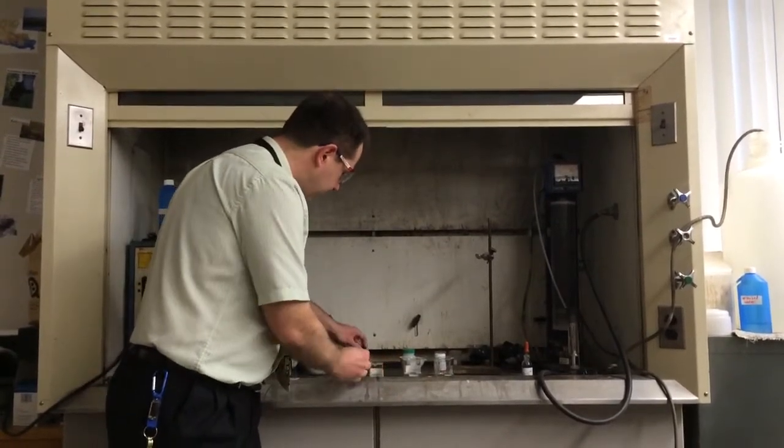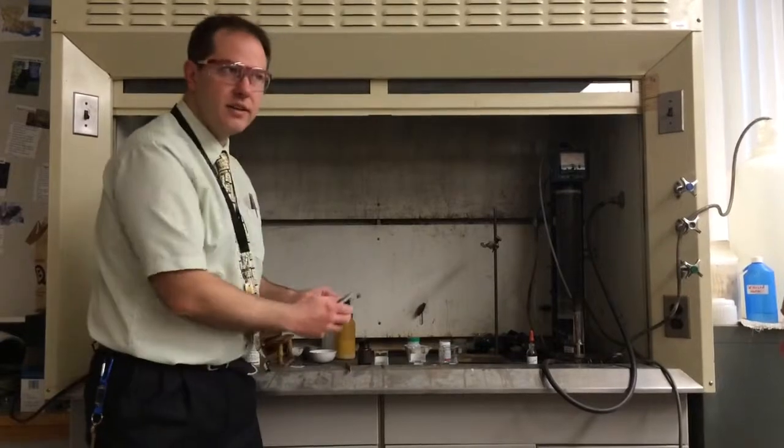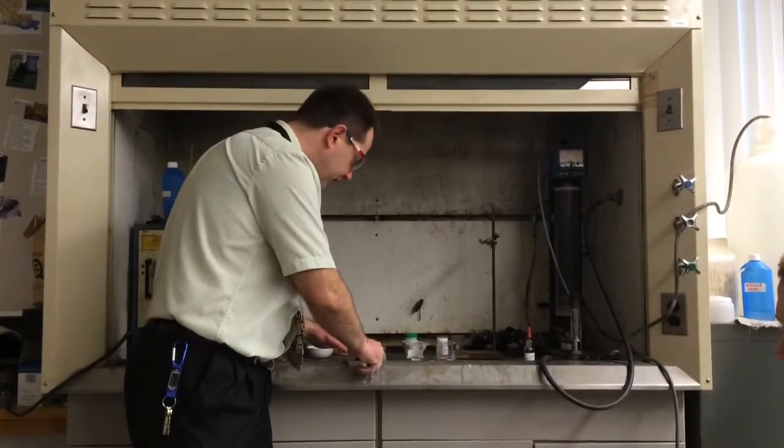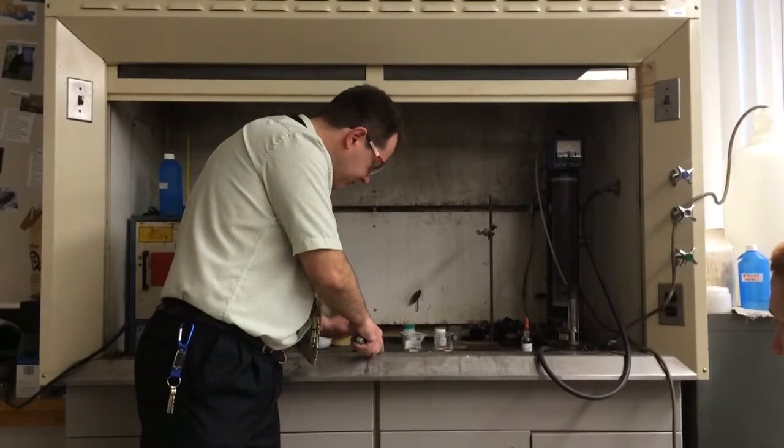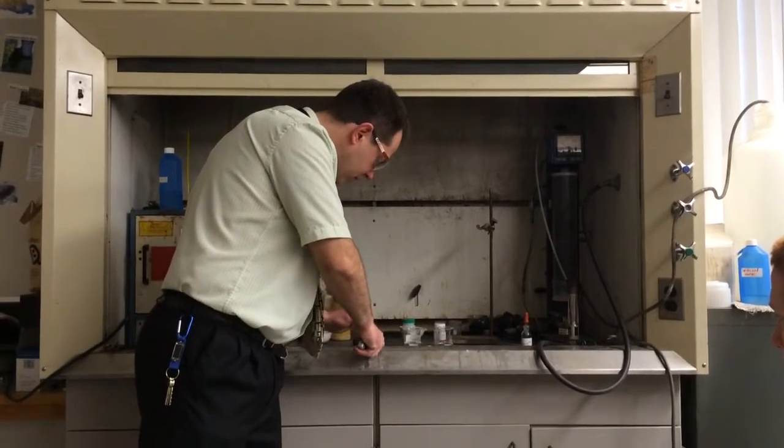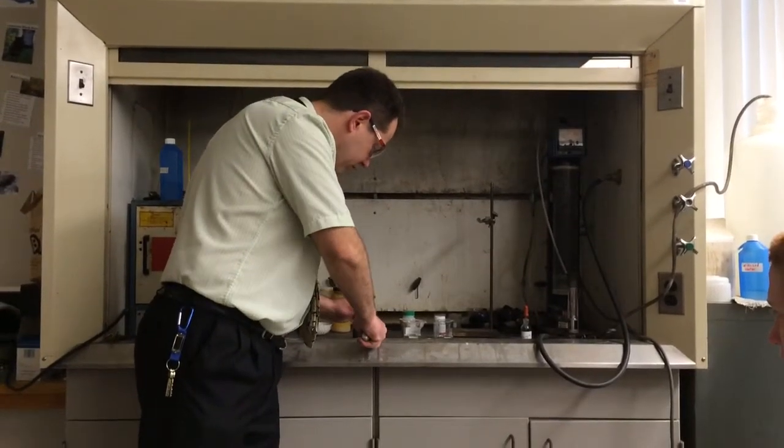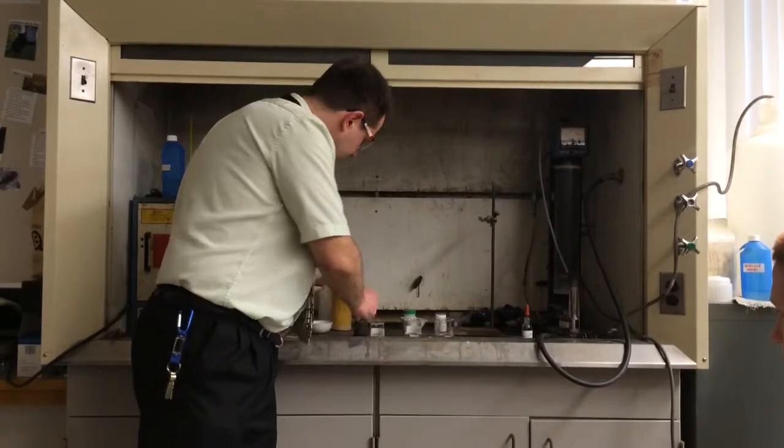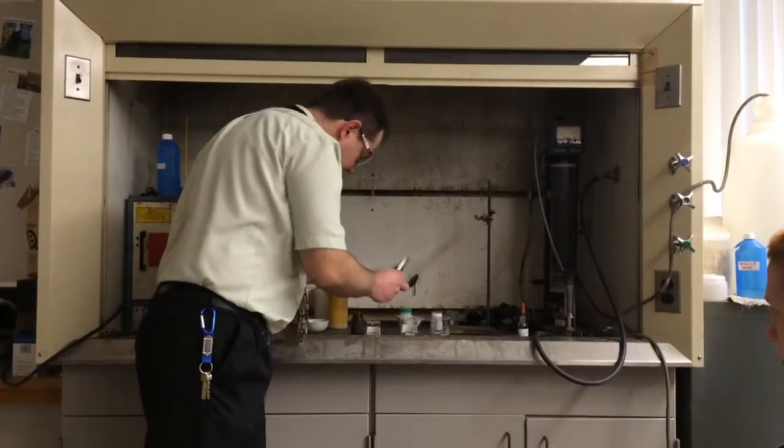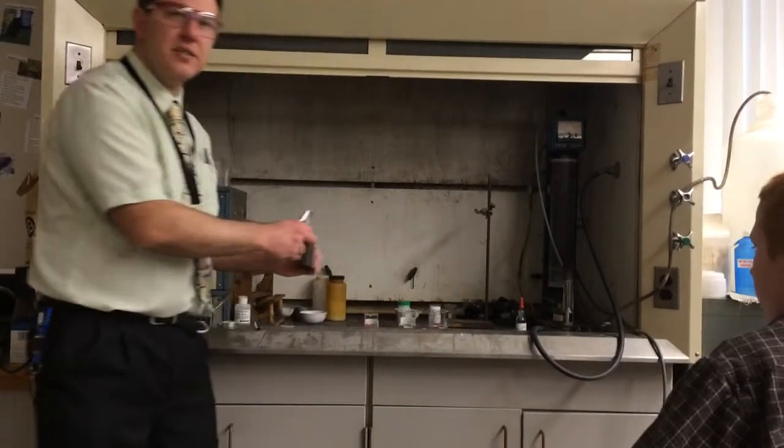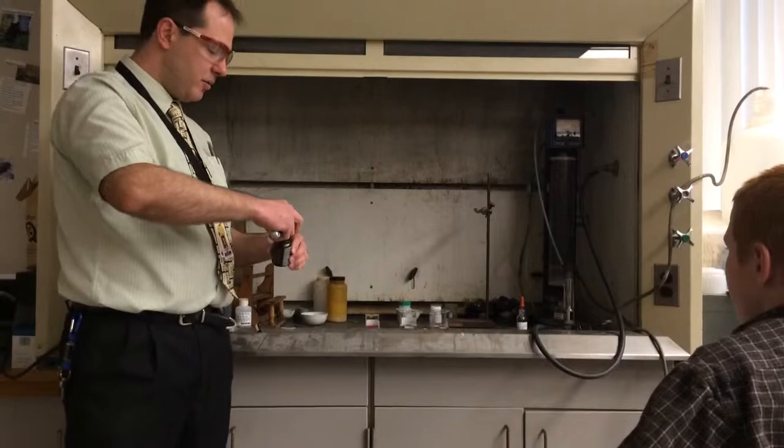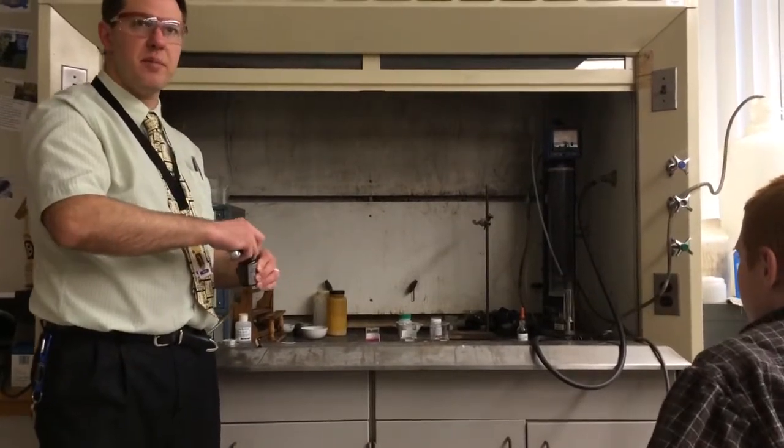And so I'm going to cut this metal. Normally you can't cut metal, right? I'm taking an X-Acto knife, cutting the metal. I've put into the solution where I'm placing this, I've placed acid-base indicator phenolphthalein. Phenolphthalein turns pink in the presence of a base.